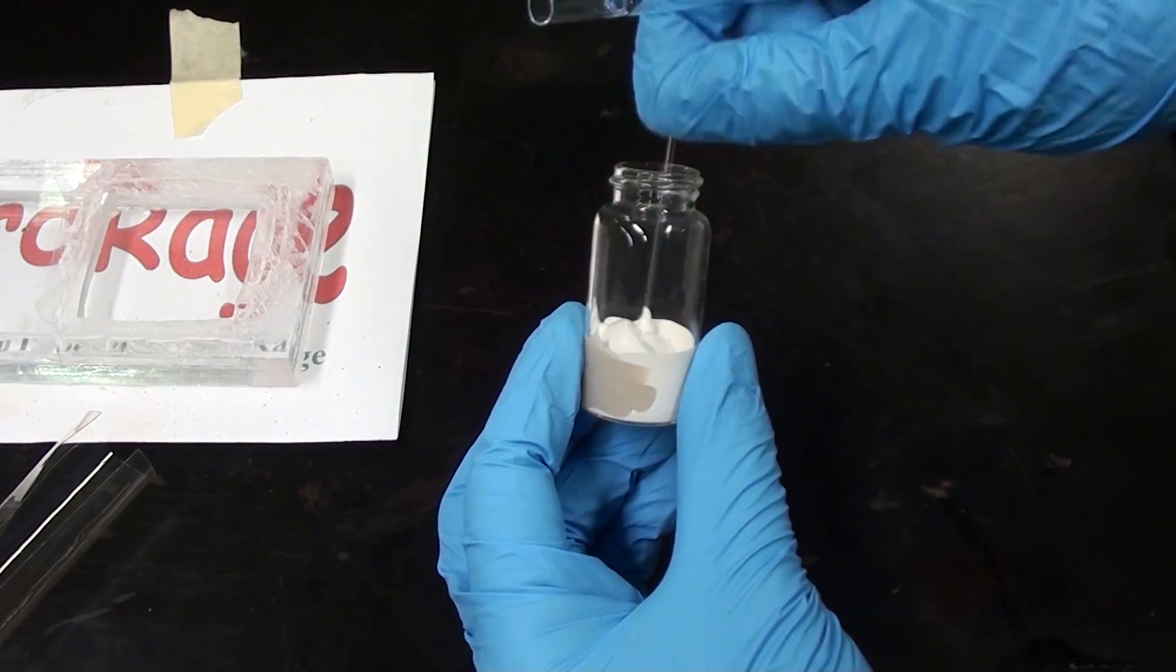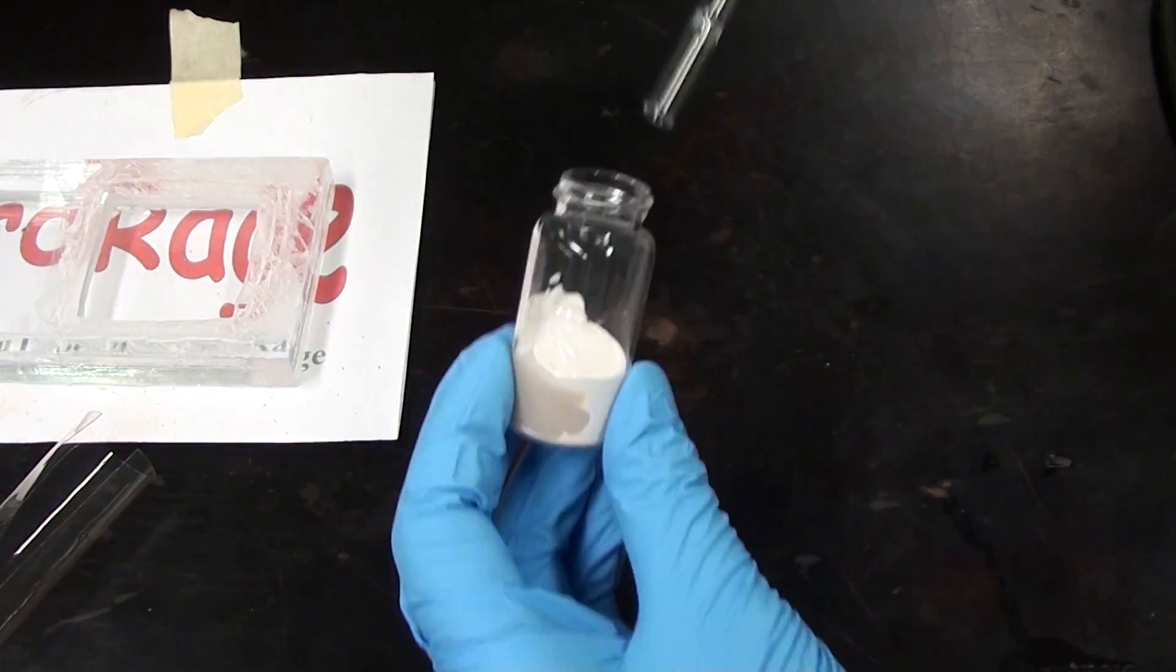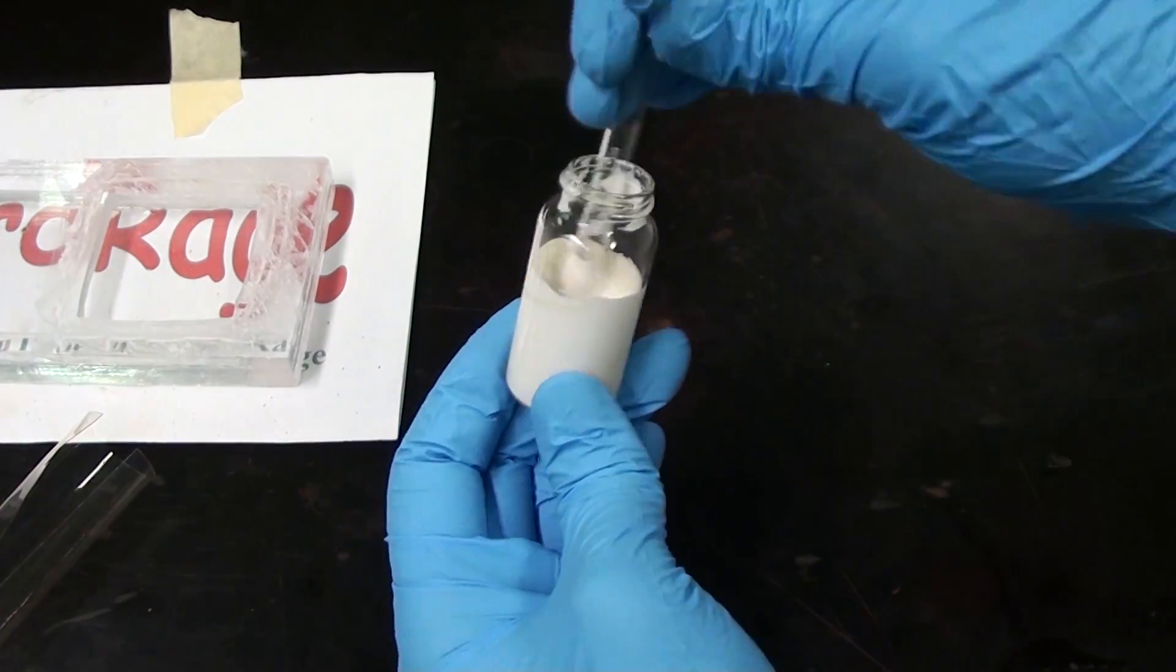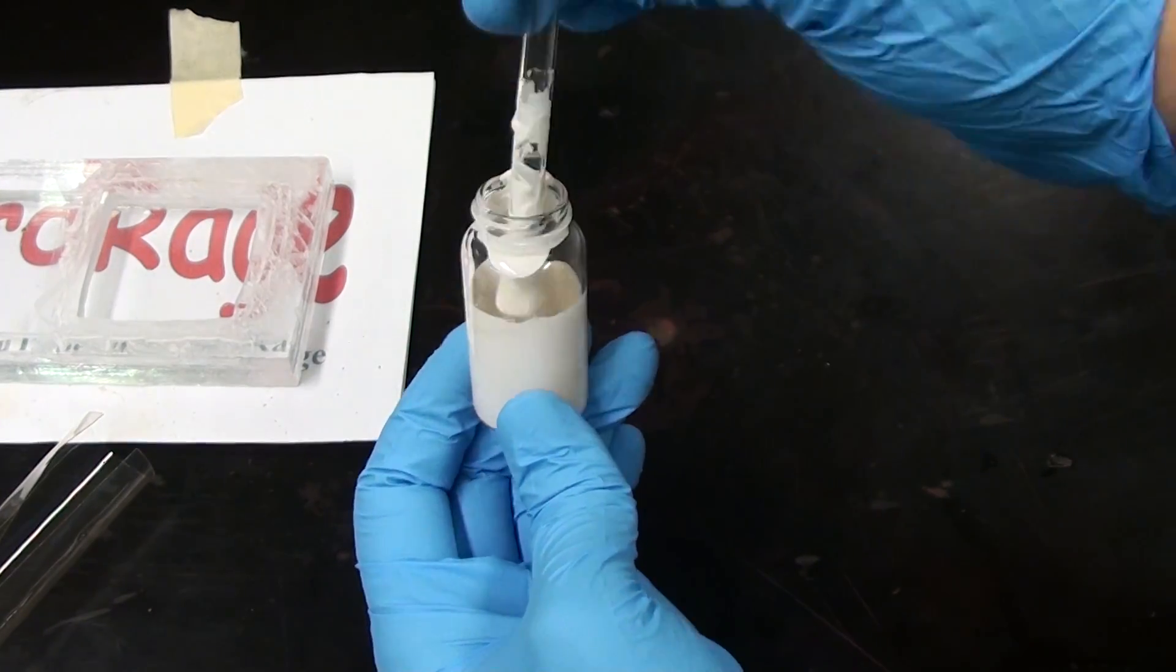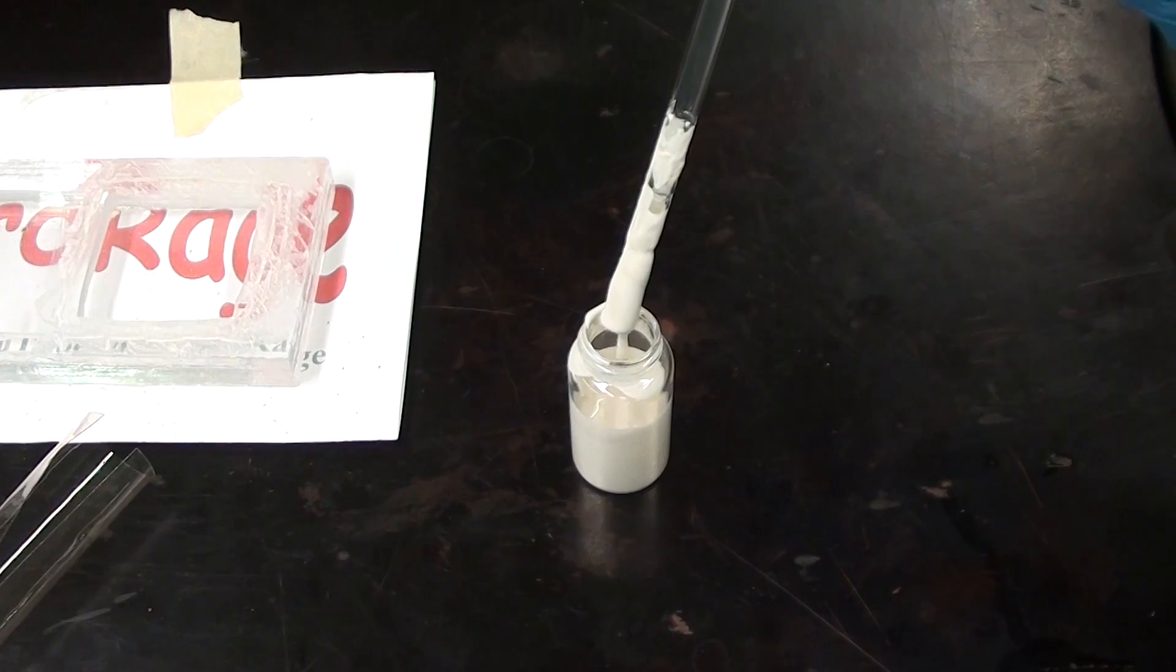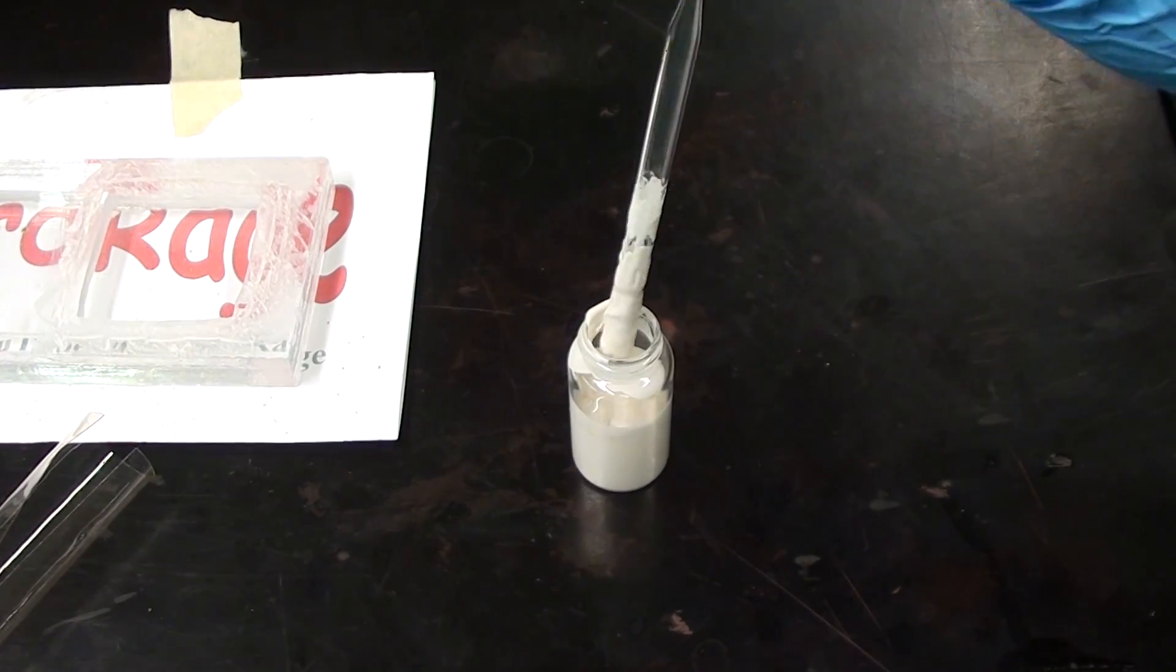I'm just going to glue the membrane in place with some marine grade epoxy. For the amateur the bulk cost is the membrane and building a disposable compartment is more straightforward and easier to prevent leaks than building one with gaskets and removable hardware. Although by all means do that if you intend to do heavy electrochemistry.